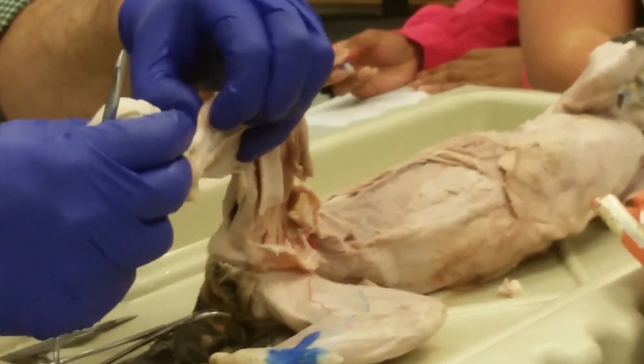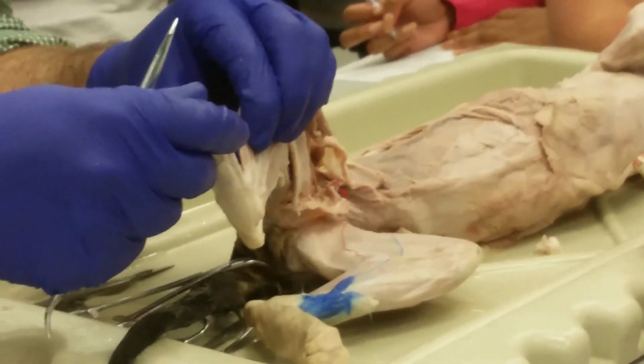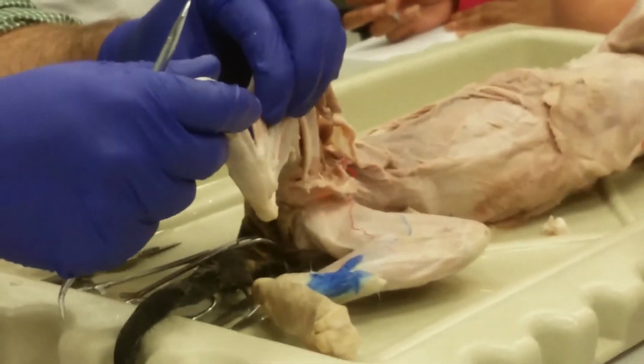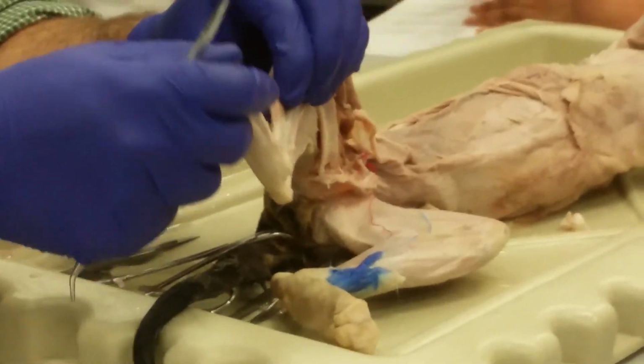So it's going to cross the ankle, right? Pulling on the top of the ankle, what's it going to do? What do we call that motion? Flexion. What type of flexion? Dorsiflexion. Very good. Okay, dorsiflexion.